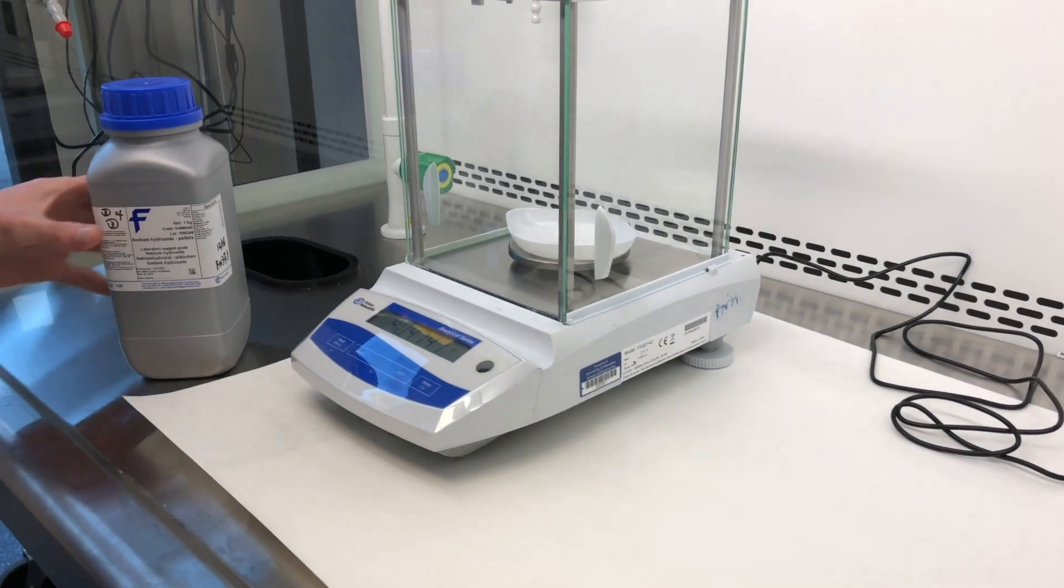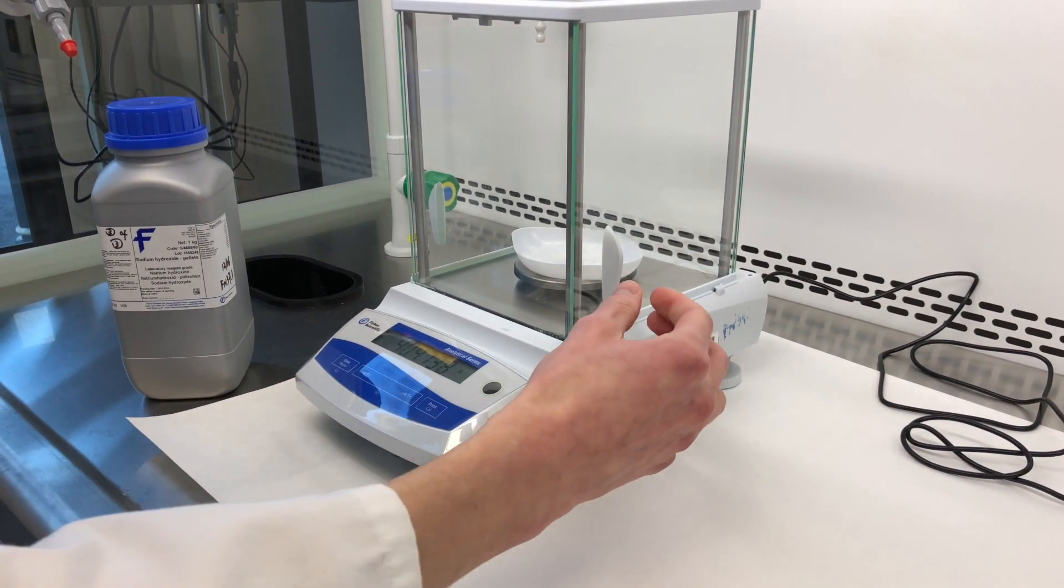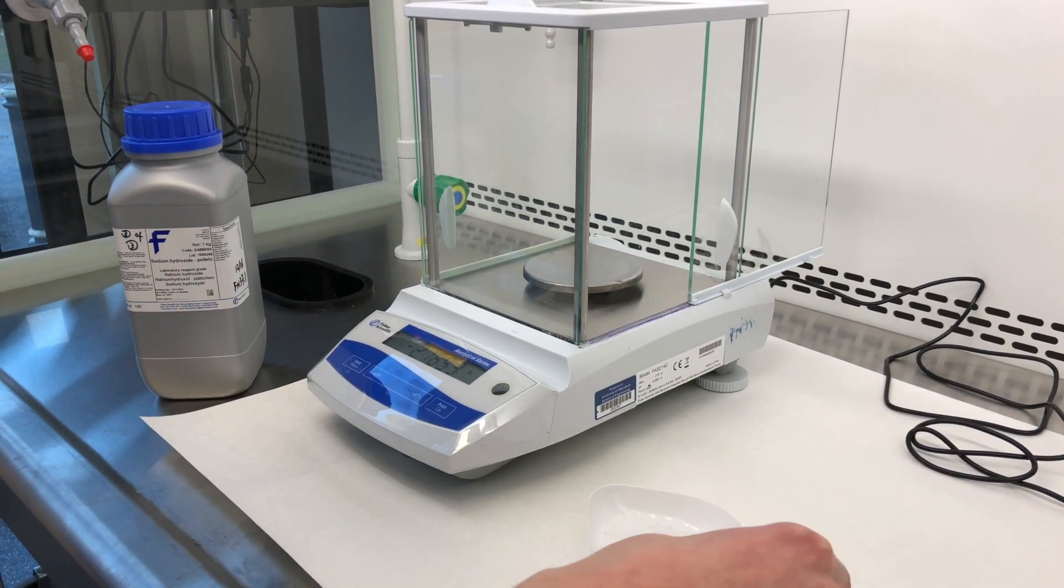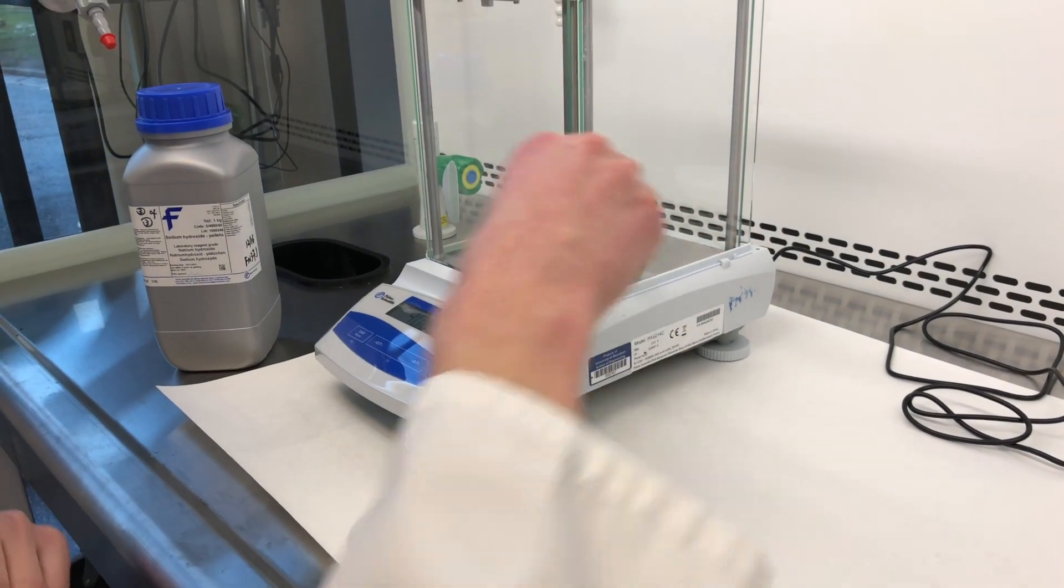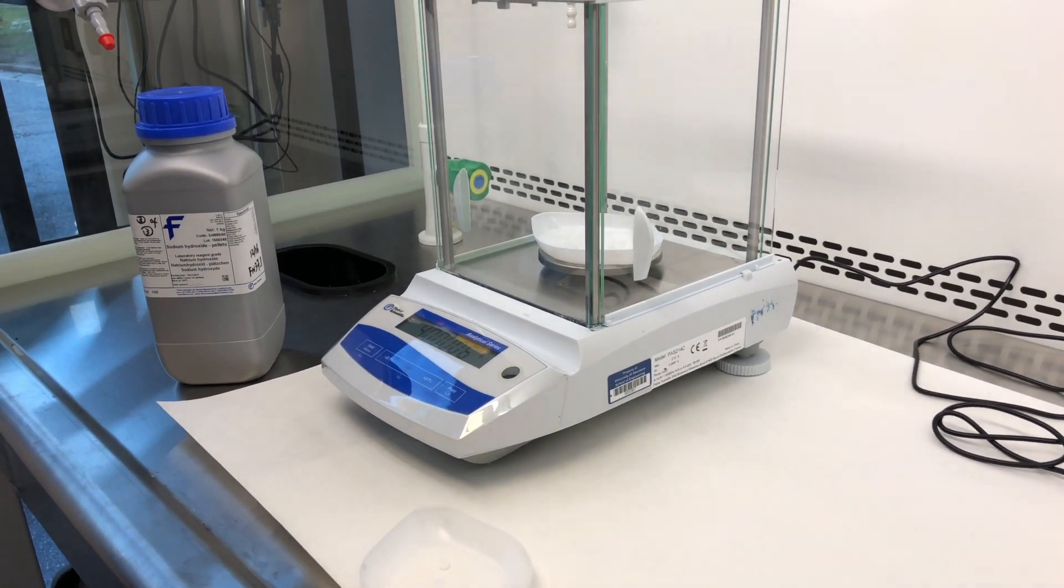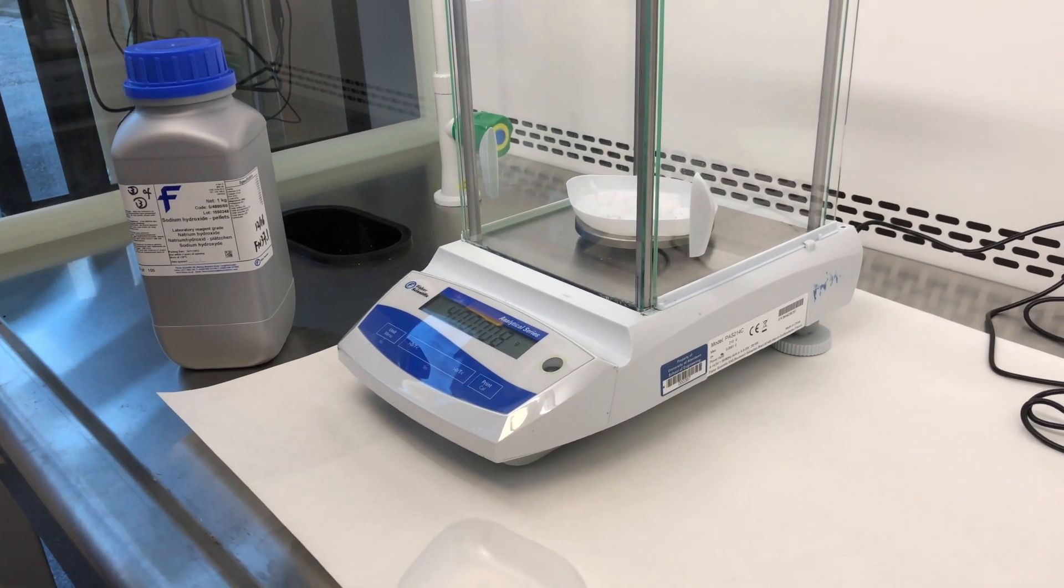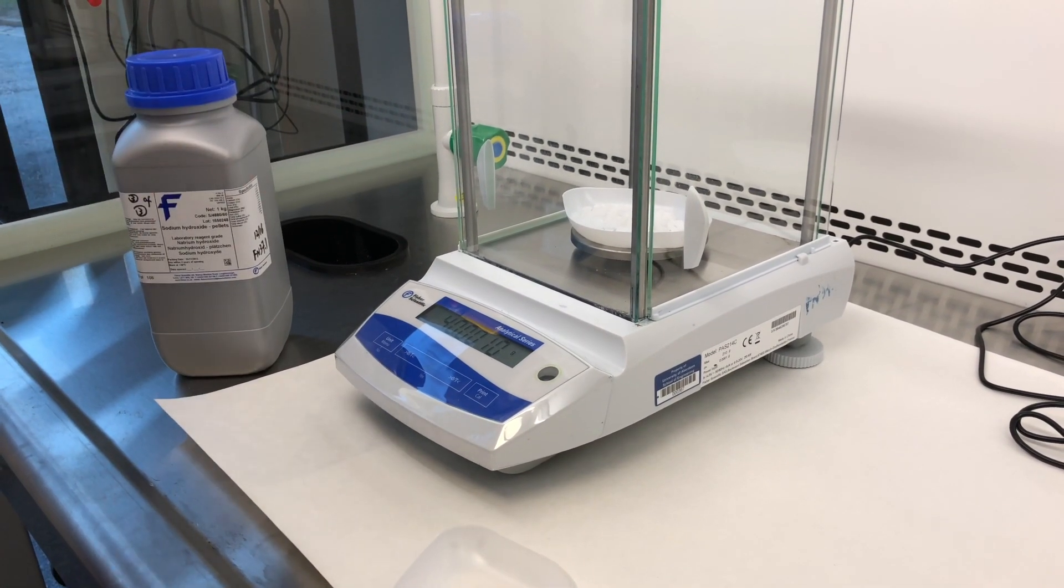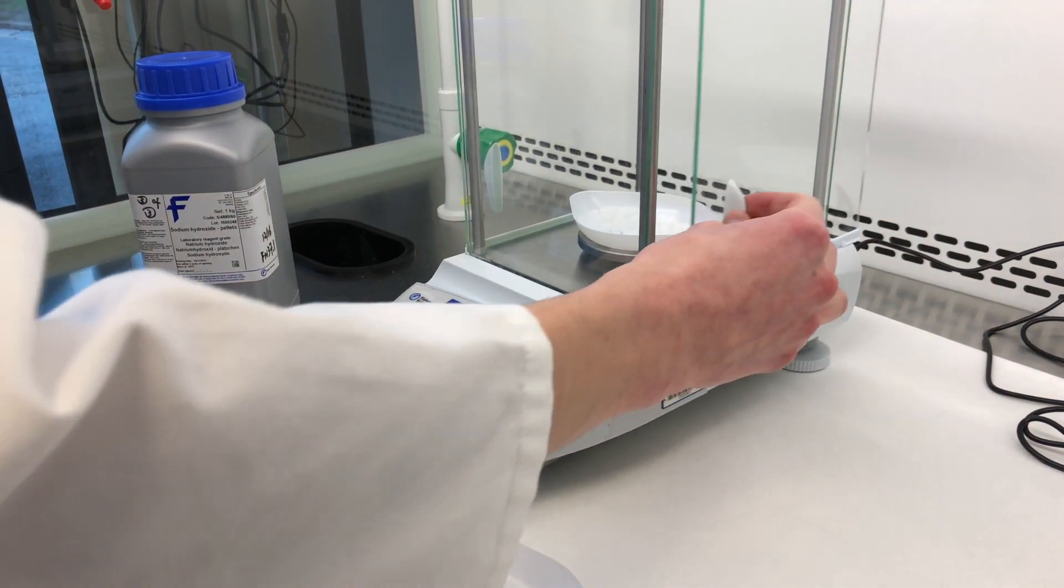We are weighing out 40 grams. So that's a fair amount there. Put it back in here, and we'll see how much it weighs. Oh jeez. So that is 40.4, so it's slightly above, so we'll just take some out. There we go. Perfect. So you can see that's 40, just slightly over 40. But the number is starting to increase because this is now absorbing moisture from the air.